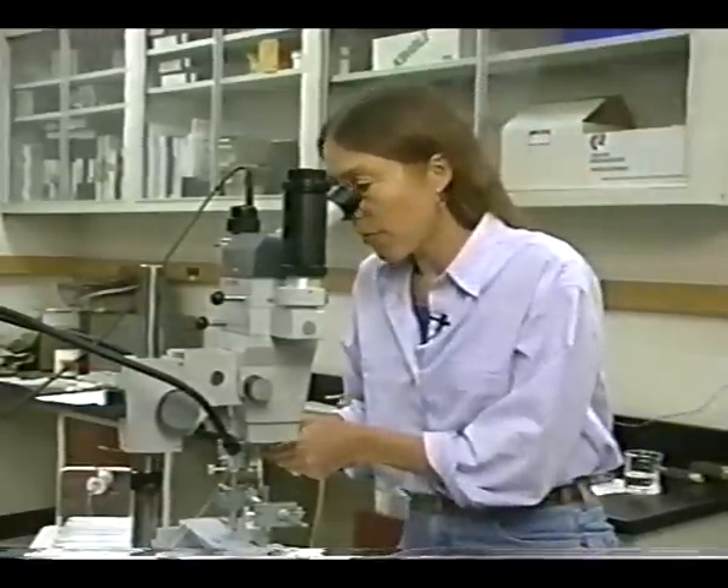The insemination is complete. Now let's look at some troubleshooting problems. If a significant amount of semen leaks out, it indicates the valve fold has not been bypassed. For example, if you come in too close to that V, you're going to sit on top of the valve fold and you'll see the tissue move with the syringe tip. This indicates the tip is not in the correct location. Back that off, stay close to the sting hook, come down behind it, lift up slightly, and go a little bit deeper for a successful insemination.